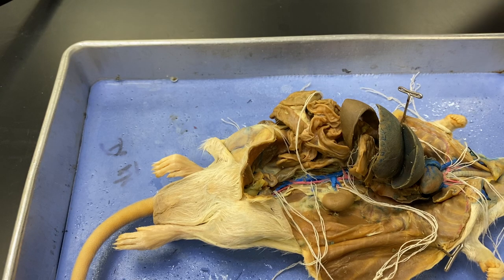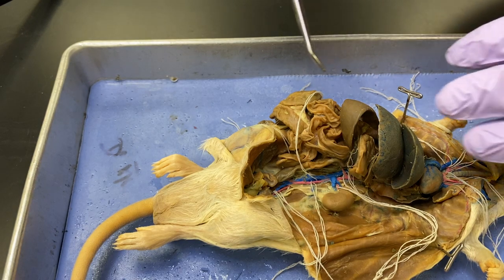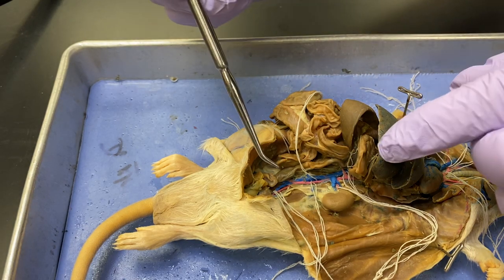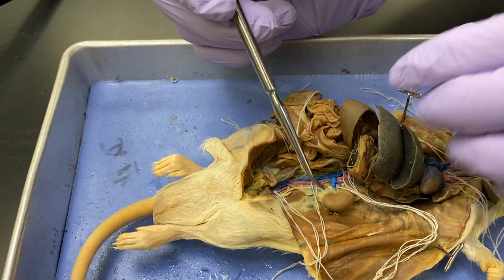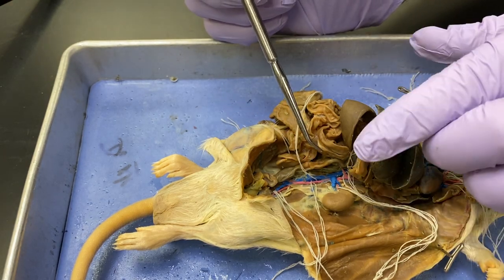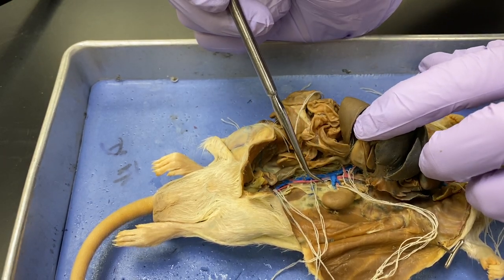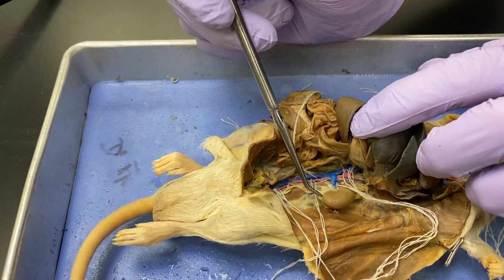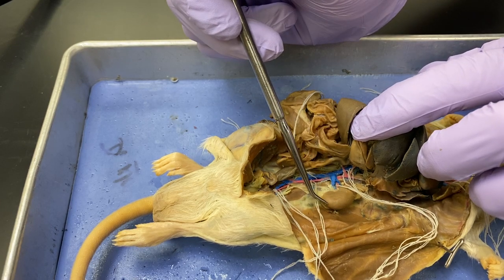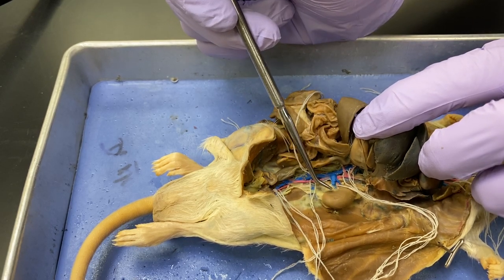All right, now we've got a rat. You remember Dr. Stringfellow from the previous episode of Dr. Stringfellow's digestive system. But here we have the inside, so we're looking at the left side — this is the left kidney right here.